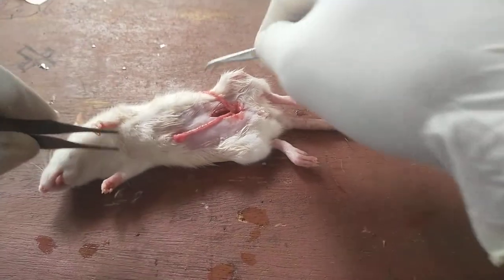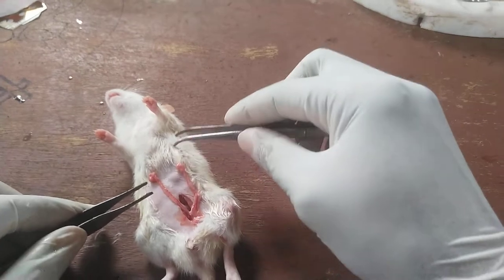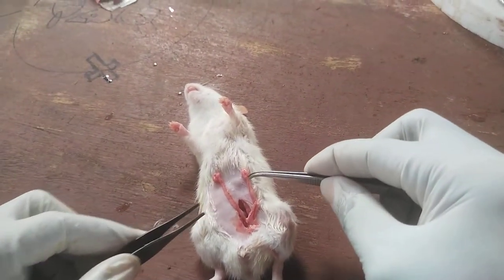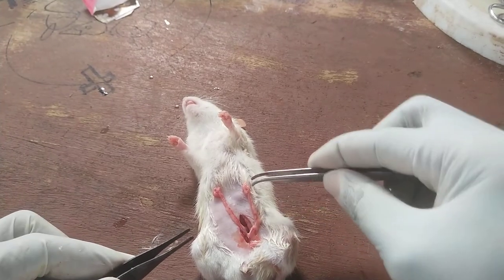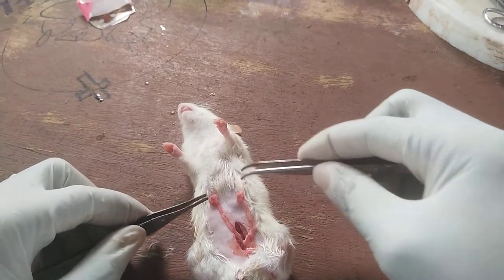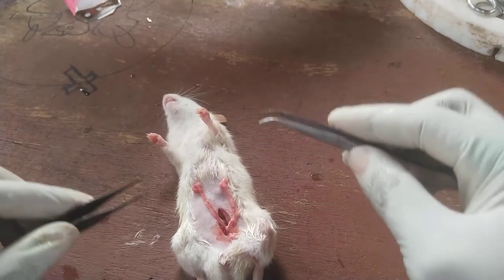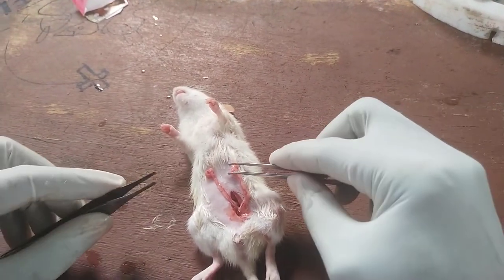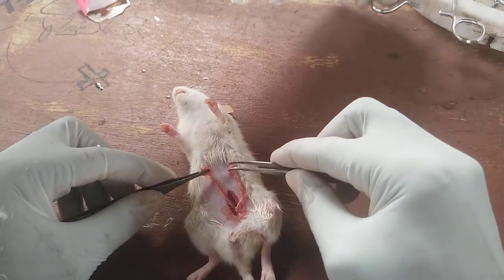These are the two horns of the uterus — this is the left horn and this is the right horn. What we are interested in is the ovary, not the uterine horn. So the procedure is to remove just the ovaries.